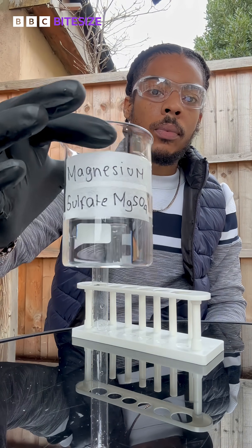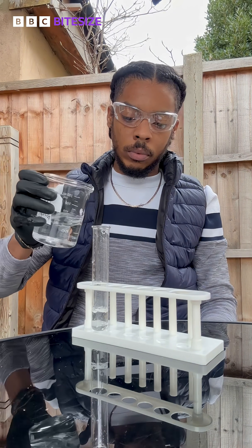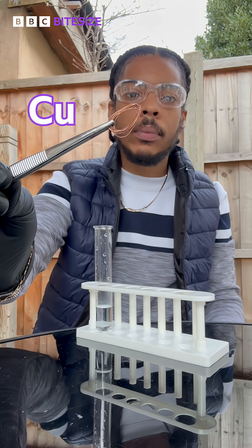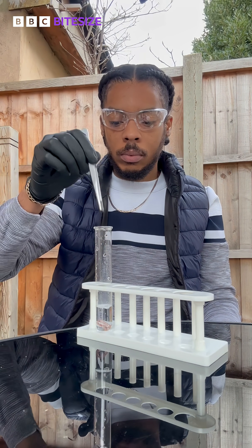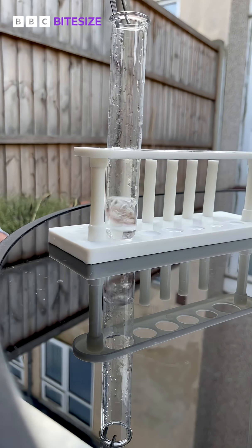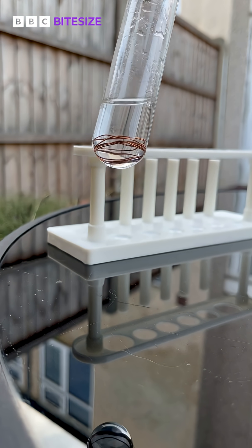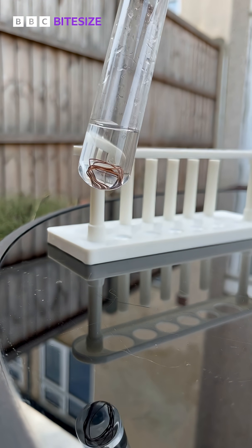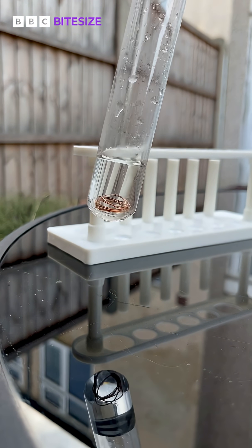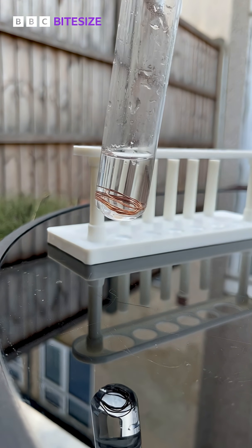Now we're going to get some magnesium sulfate and react it with some copper metal. When you add copper to magnesium sulfate, no reaction occurs, and that's because copper is less reactive than magnesium, so it's unable to displace the magnesium in magnesium sulfate.